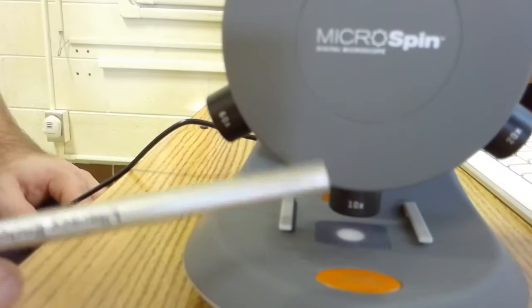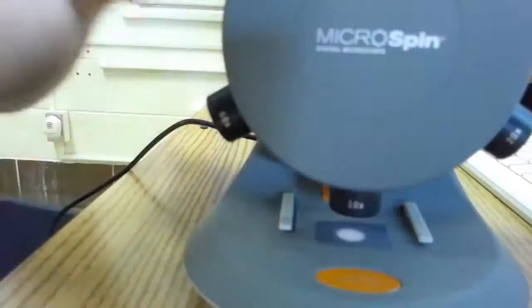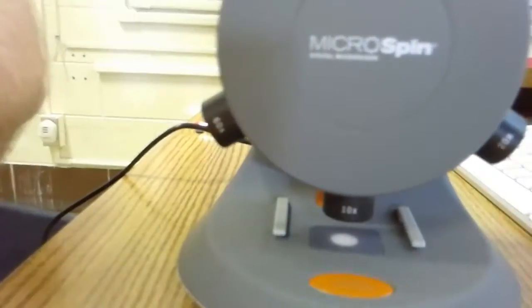So before you insert a slide or do anything else, you want to spin the wheel gently. I'm going to back out a little so you can see that.